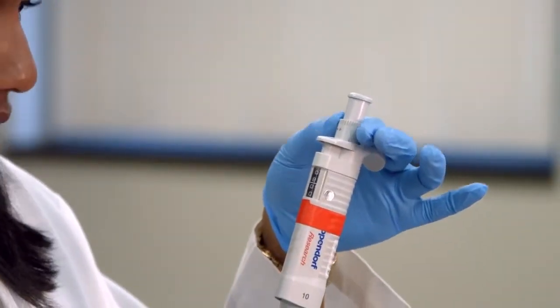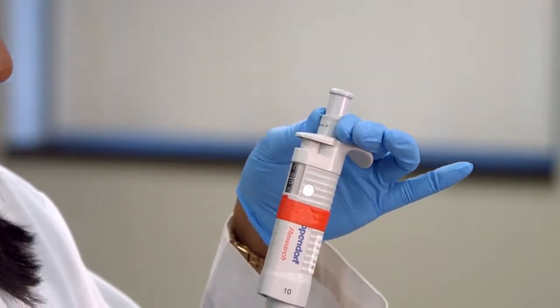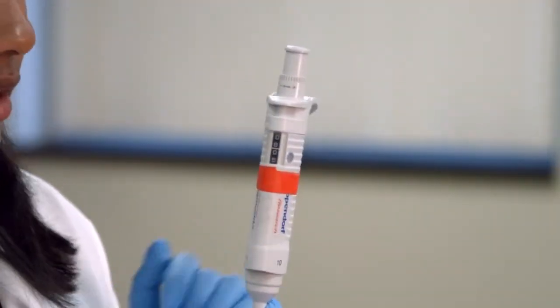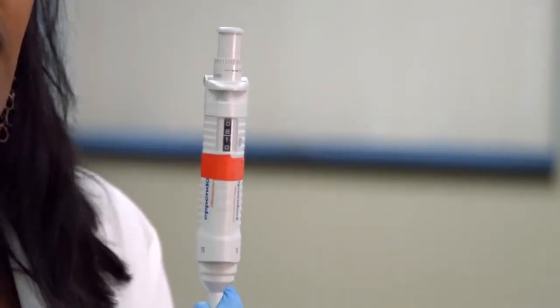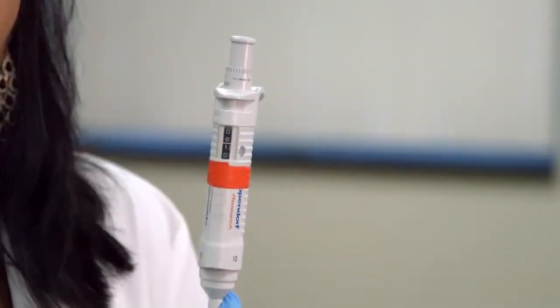So this is 8 microliters, and this is 8.05 microliters, or 8.1 microliters. So not 810, but 8.1.